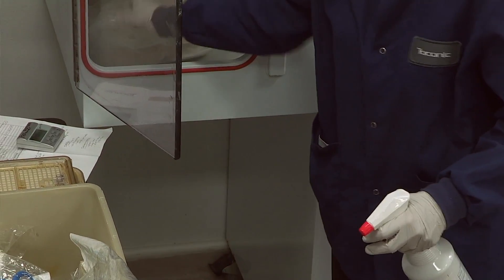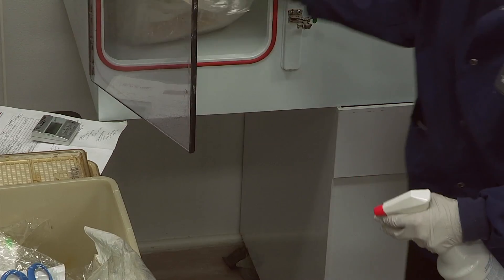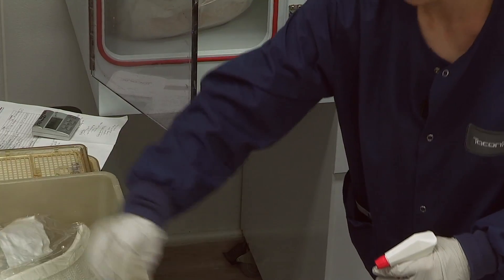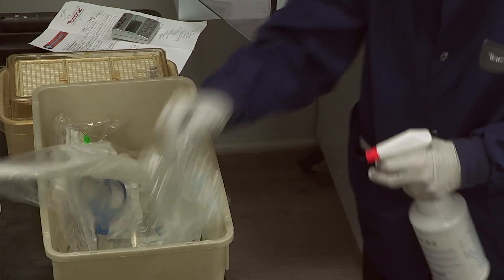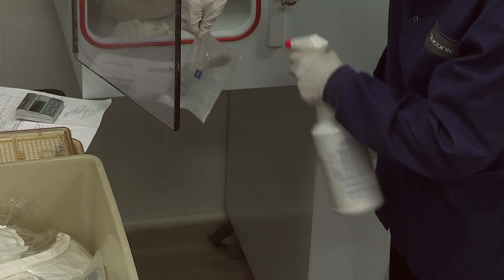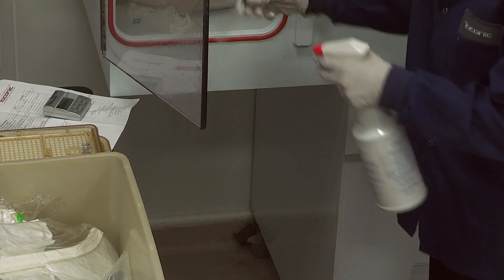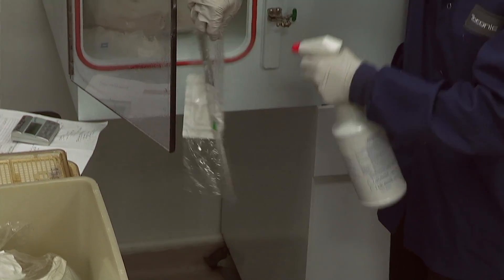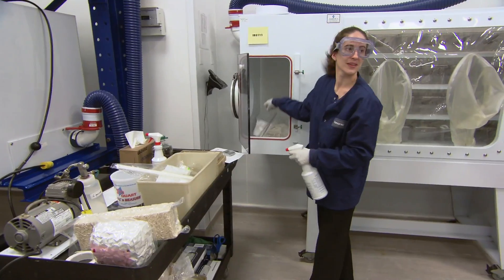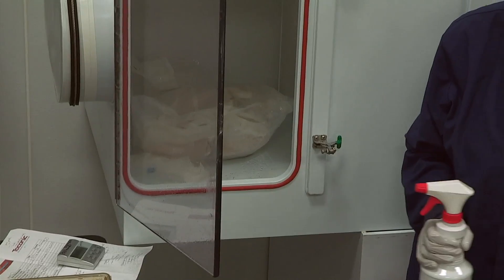We request from the manufacturer that our bedding is double bagged so we can spray it with ease. This would be typical supplies that you're going to put into an isolator — some of them you would put in at the beginning and some you'd put in week by week.